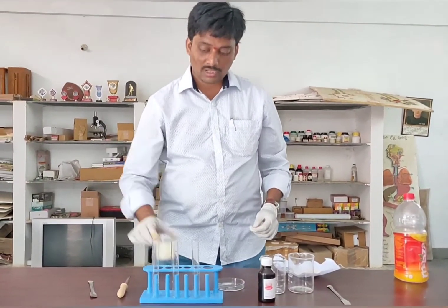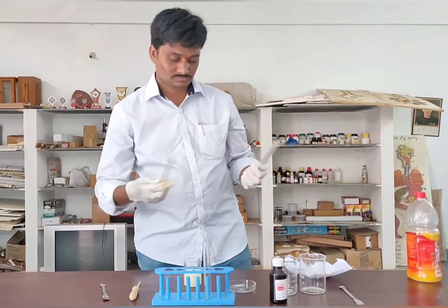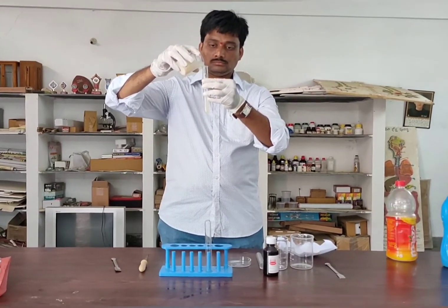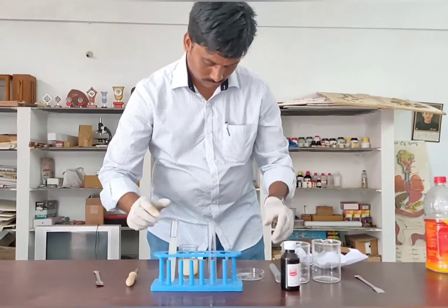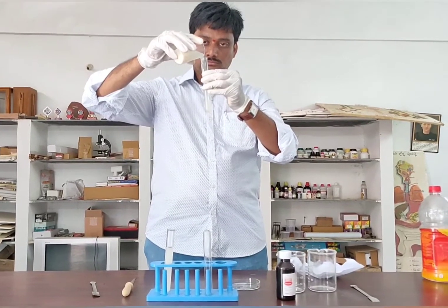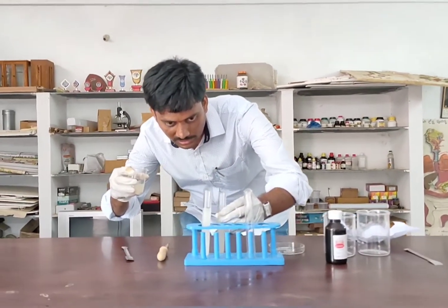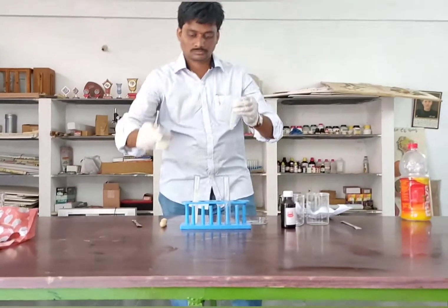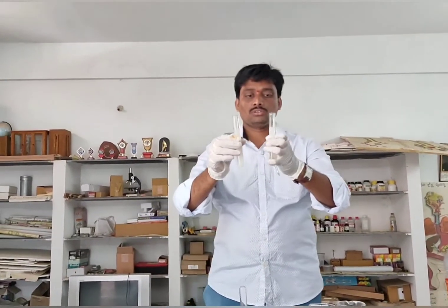Now, whatever the prepared flour solution, we have to divide it into 2 equal halves by taking 2 test tubes. Equally, we have to divide the solution. We have divided it equally into 2 equal halves.